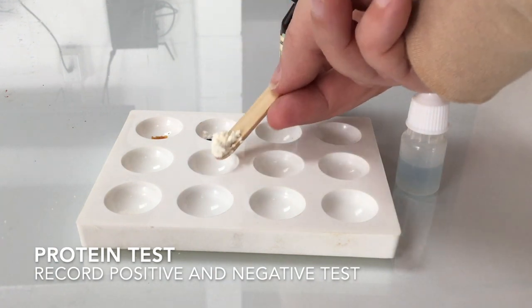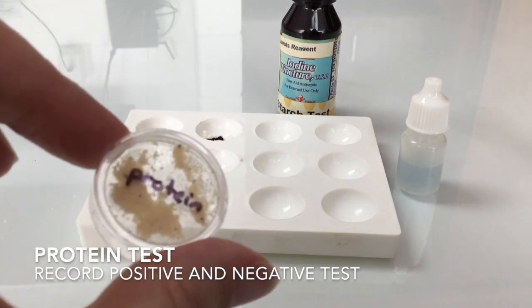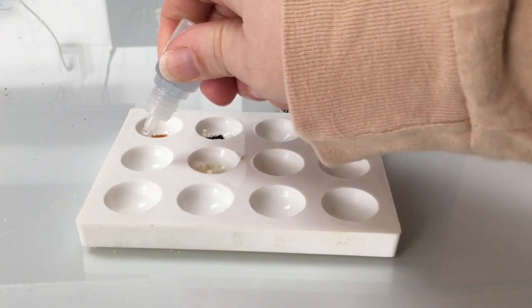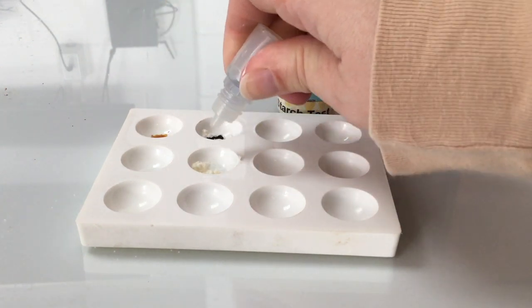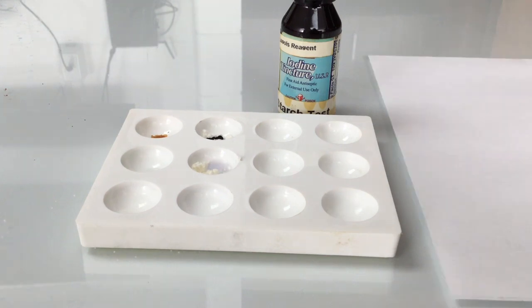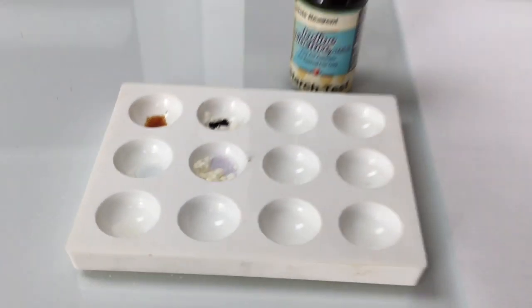Next, we will do the protein test. So we're putting a sample of protein, in this case powdered egg whites, into the second column, and we'll use this light blue solution, Biuret solution, and put some in the salt, which has no protein, and some in the egg whites, which are mostly protein. Now this test will take some time to react, so we'll take a look at it later. After several minutes, you can see that the negative test is still light blue, but the egg whites have started to turn purple.